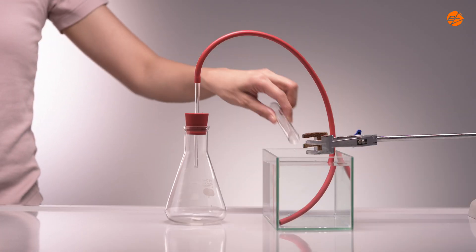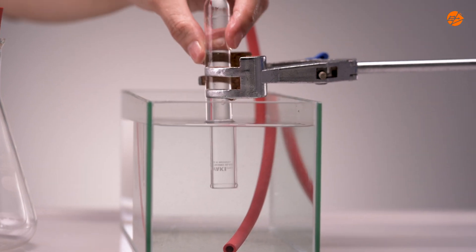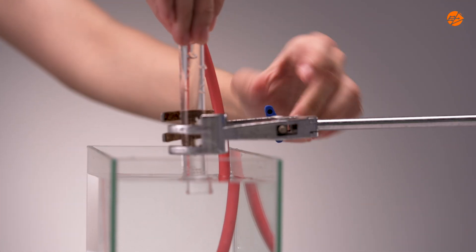First, invert the test tube and fill the entire test tube with water. This should be done before we carry out the reaction.